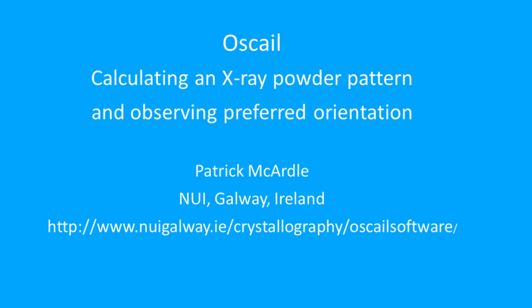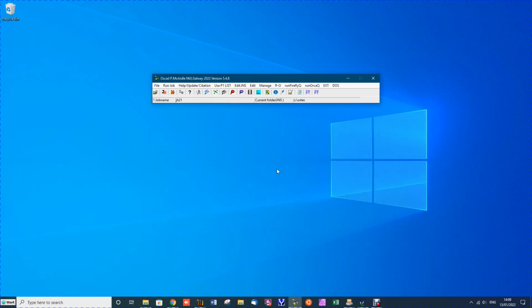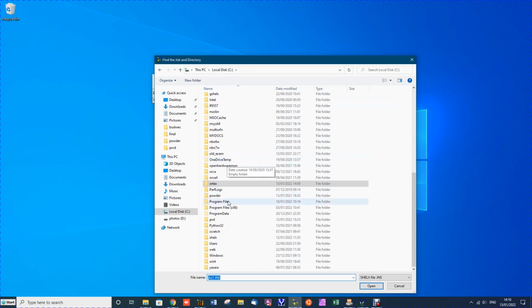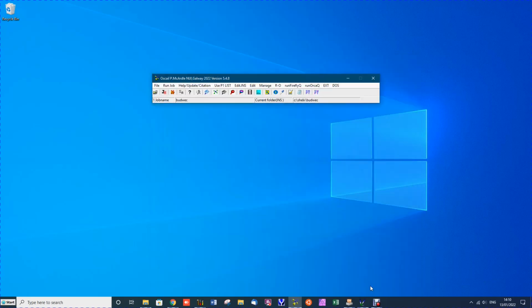In this video I'll show you how to simulate a powder pattern and compare it to observed patterns. Open Oscail and then open the shelx folder. In the shelx folder there's a subfolder BUDWEC. Open the BUDWEC job and then look in the folder.